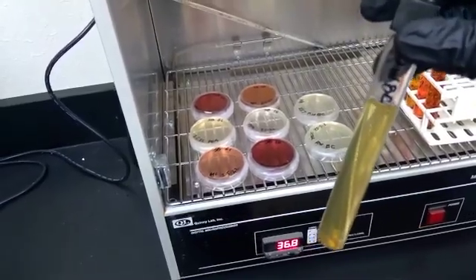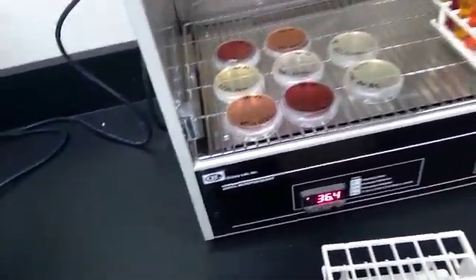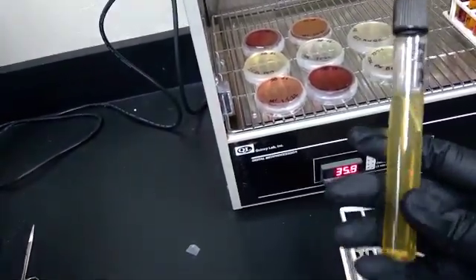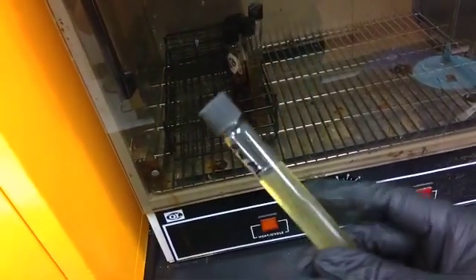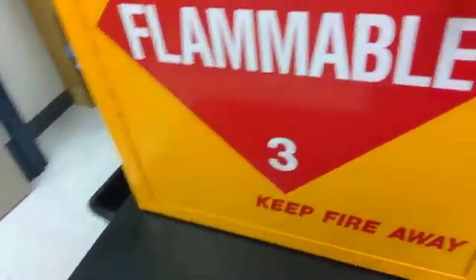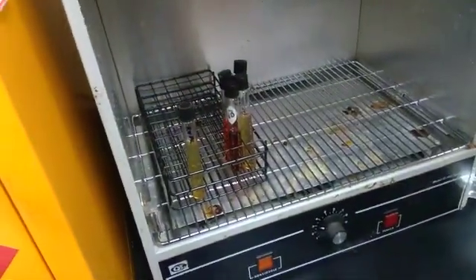I had my sim tube and my phenol tubes, sucrose and dextrose. You can see the S and the D, lactose and maltose. Now for reference, I also made a Micrococcus luteus tube because this one, again, from my Bergey's manual, I know that this one is a 25-degree bacteria. It likes it at 25 degrees. So in this case, I'm going to put it in the 25-degree incubator.